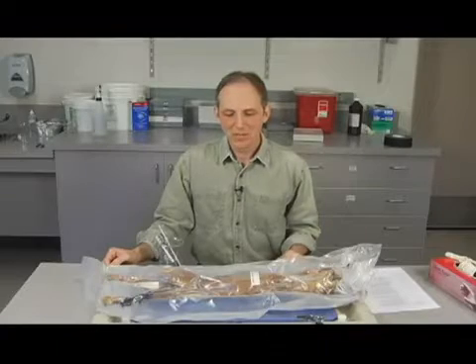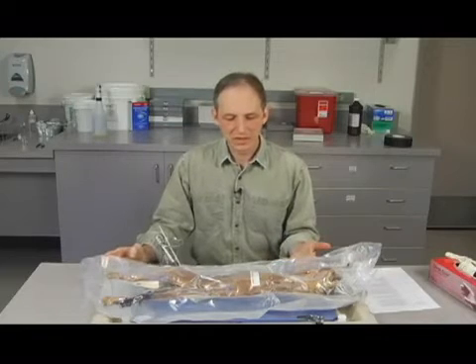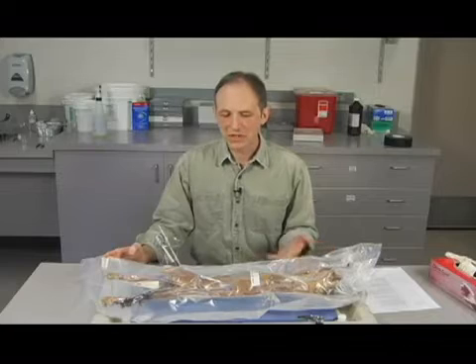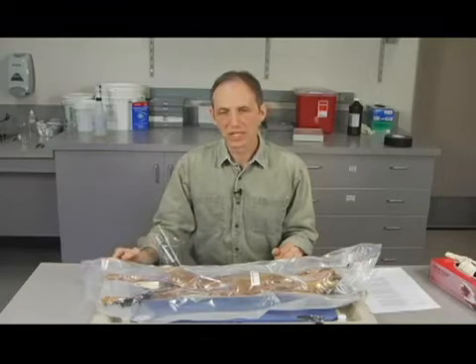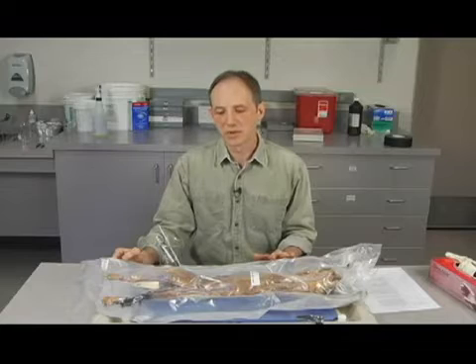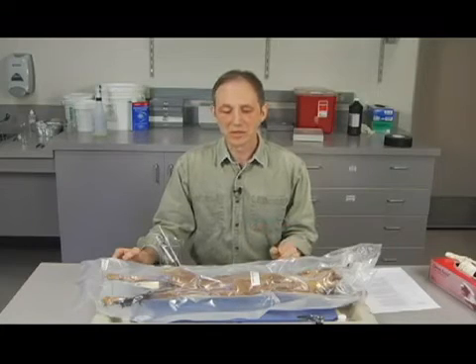Okay, so a minute ago you got a view of the cat, and as you can see, it's here in a plastic bag. The cat's actually inside a couple of bags here. There's an outer one and an inner one. And in between there's some fluid. That's basically a fluid that preserves the tissues of the cat. And if we're going to use them more than once, and we certainly are, we want to be able to keep these cats in as much of that fluid as possible.